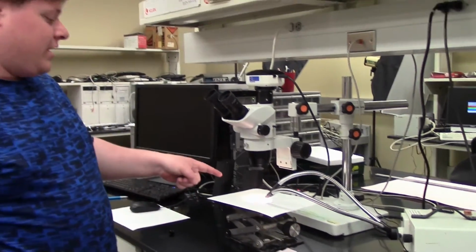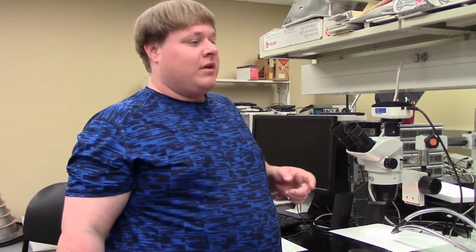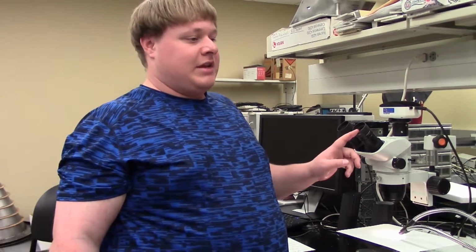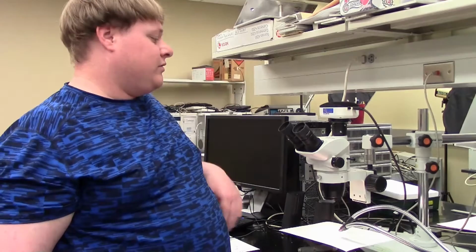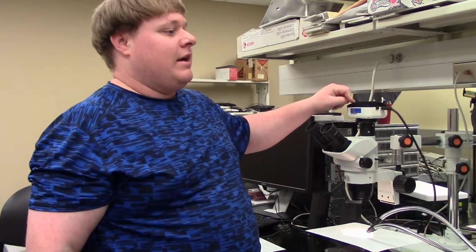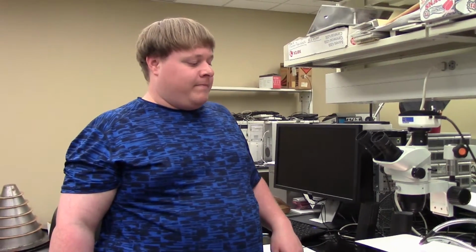Now with the calibration slide, you want to zoom in and focus to where the grid line, which is basically the small ruler that is on there, is visible, really in both eyepieces, but particularly this eyepiece. Once that's focused in, you pull this tab back, and this feeds the view directly to the camera. And from there, it will connect. Then you can open up the computer, open up the software, and do your measurements there.